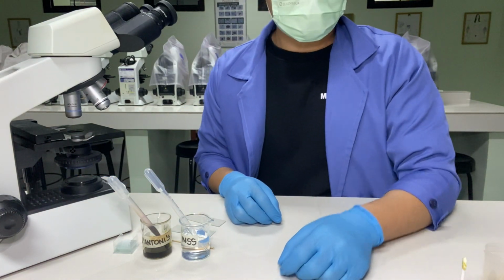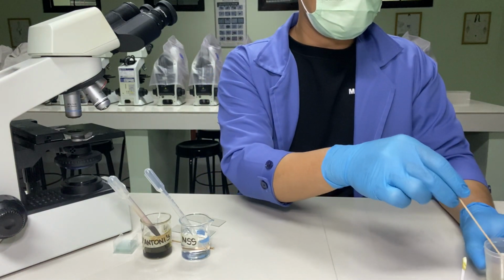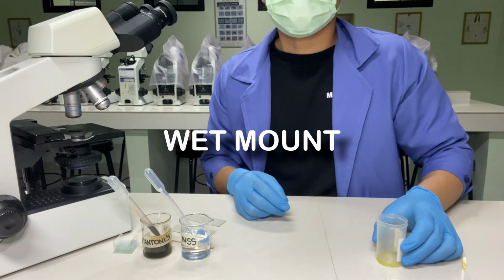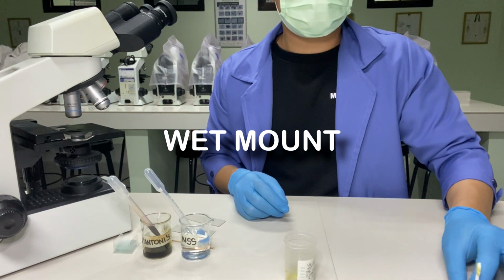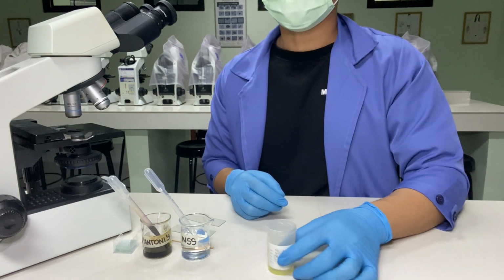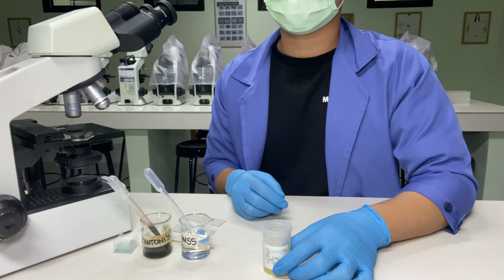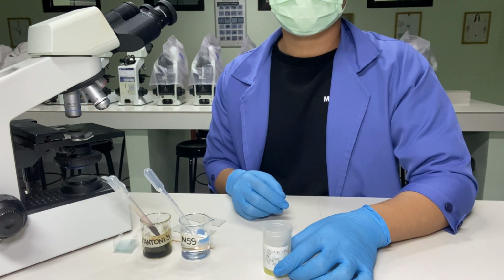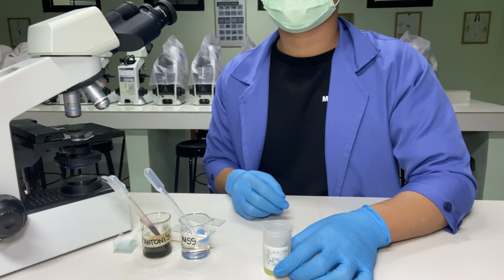For the next activity, we will perform wet mount. Wet mounts are recommended for the detection of motile trophozoites when liquid or diarrheic specimens are received. The direct wet mount is performed to detect motile protozoan trophozoites and to determine cellular morphology.